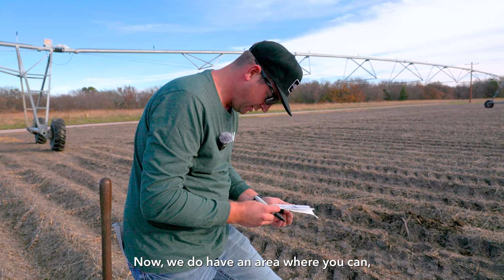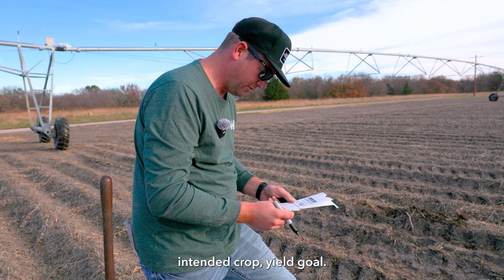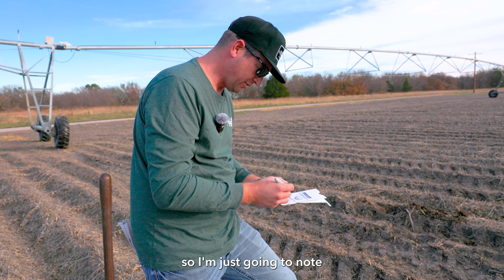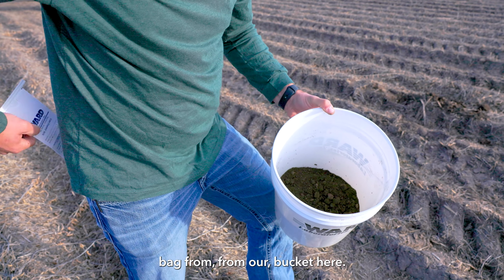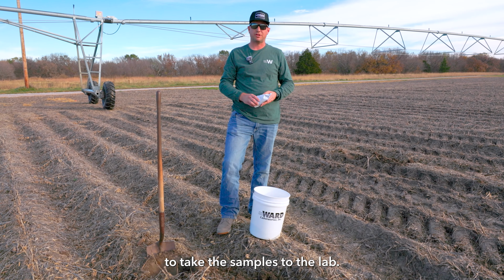Now we do have an area where you can put your sample depth, intended crop, yield goal. You know, I'm not sure what we want to do next year for a crop, so I'm just going to note my depth here, 0 to 8 inches. And then we'll go ahead and take our sample bag from our bucket here. Okay, now we're ready to take the sample to the lab.